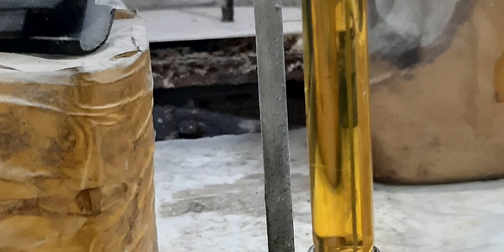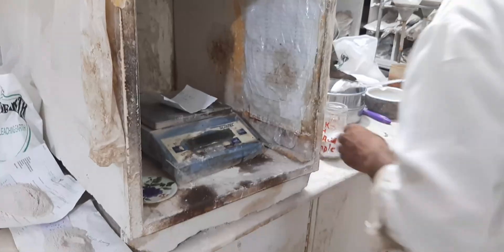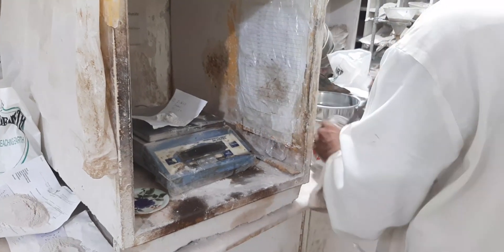Now in this image, you can see the result. It's better than the previous result. Now we will check results using 8% dosage of bleaching earth and repeat the procedure again.